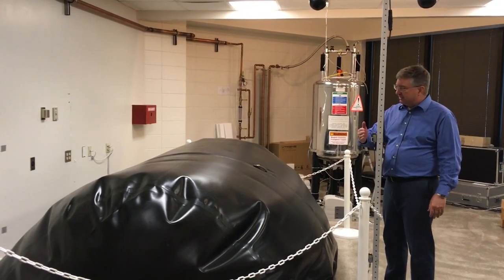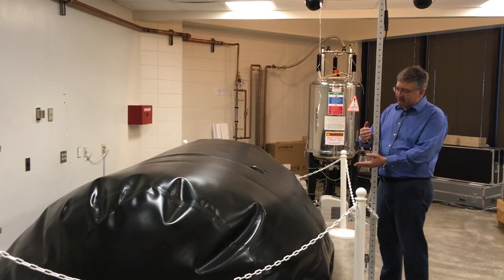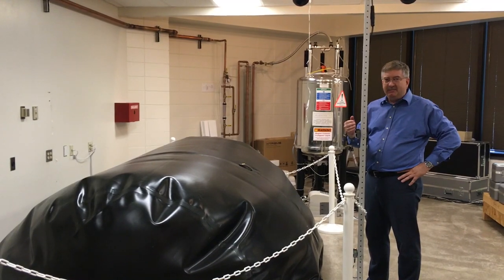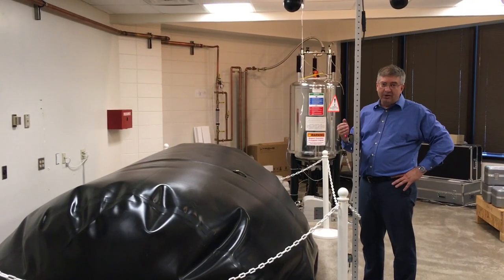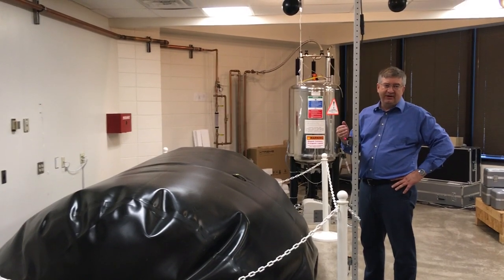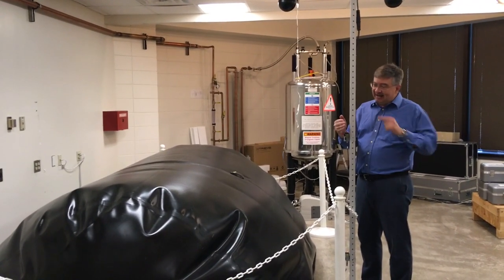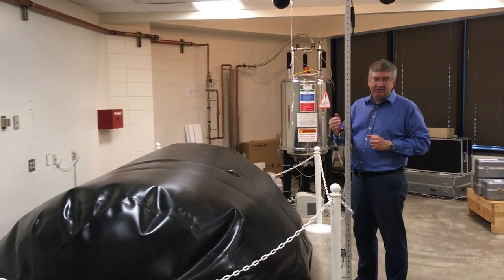I'm going to trigger this and start a compressor that will eventually empty the helium out. This balloon stores the helium that is boiling off of liquid helium in the magnet behind us. That liquid helium is keeping a superconducting magnet in that nuclear magnetic resonance spectrometer at four degrees Kelvin — about 452 degrees Fahrenheit below zero. Really cold. Helium is an increasingly precious commodity and we're trying to capture every bit of it and recover it to conserve this precious resource.